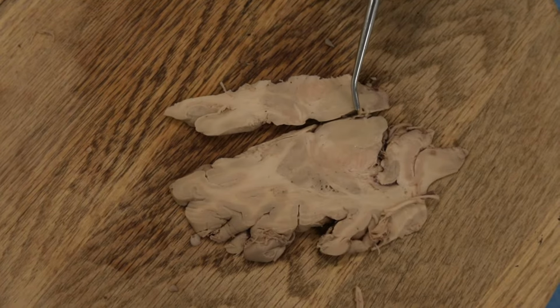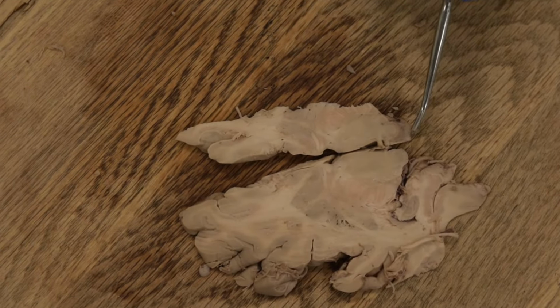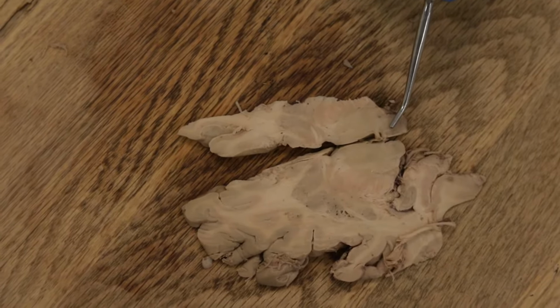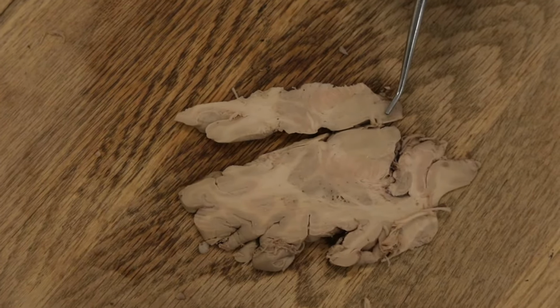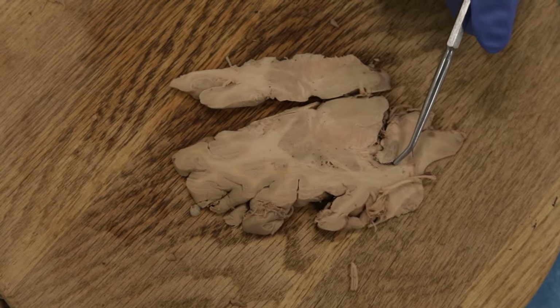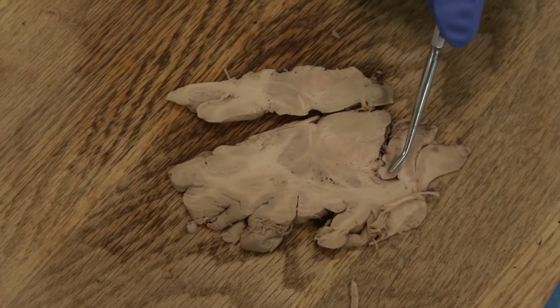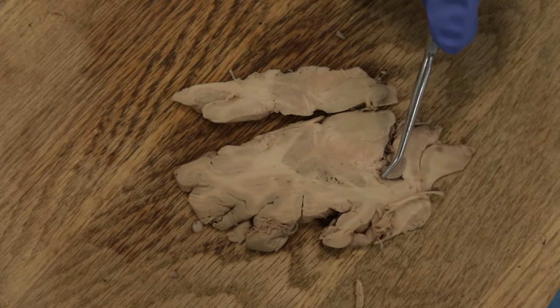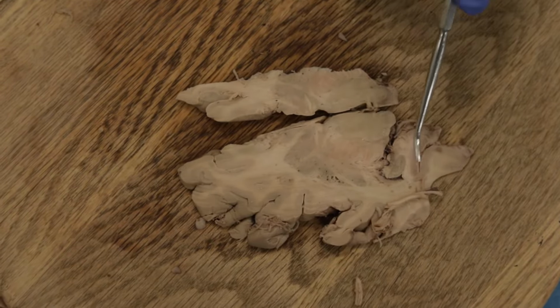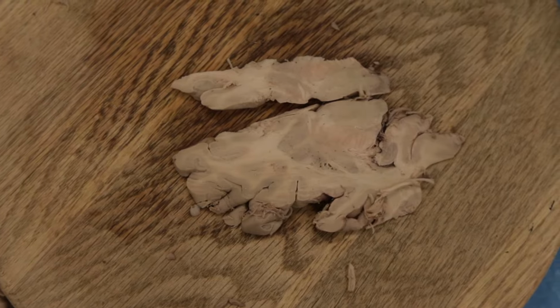Okay, so here, as I said, is the posterior commissure, important for the pupillary light reflex. And this is the superior colliculus. Okay, the tectum of the midbrain back here. All right. If we move out laterally, here's the temporal horn of the lateral ventricle, and here again is the hippocampus. Tail of the caudate is up in this location. Okay, and out laterally we still have some optic radiations here, providing vision back to the occipital lobe.